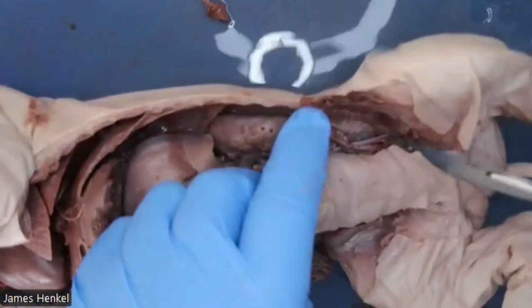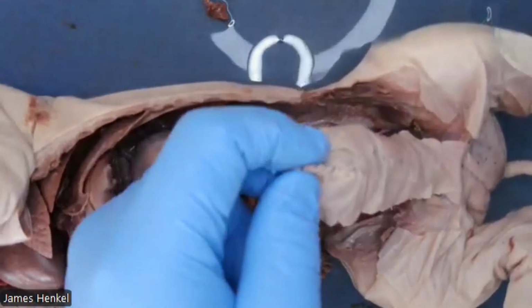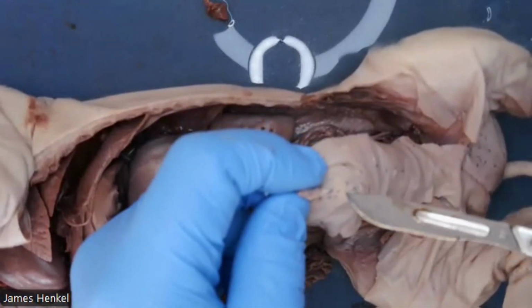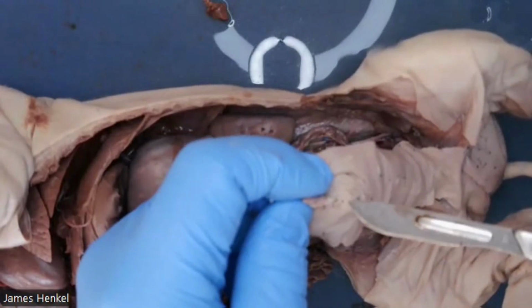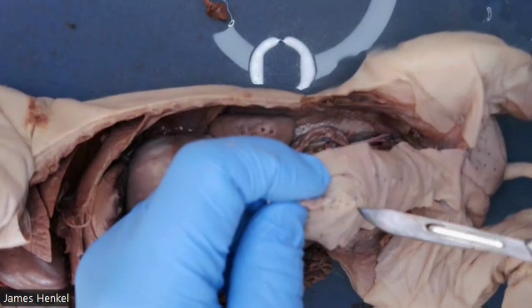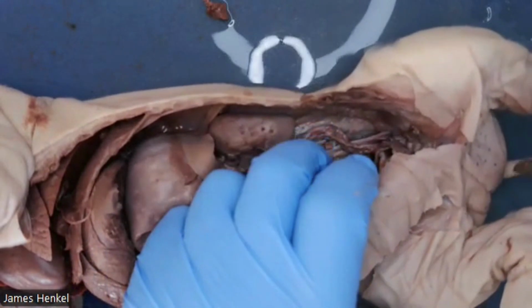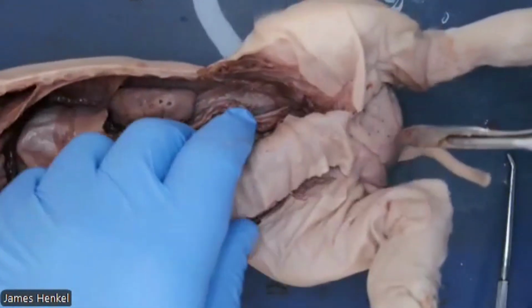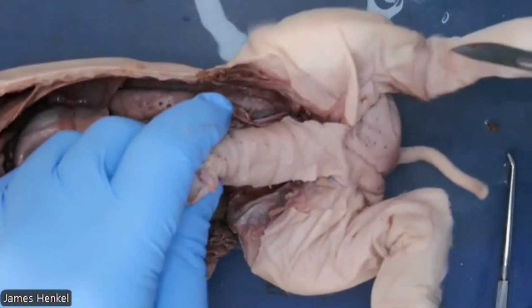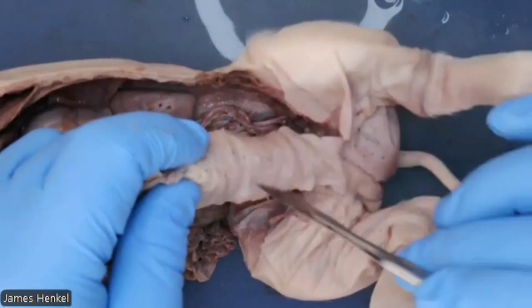Good morning. We are going to look at the male reproductive organs in this case. And what you can see first is that this is the urogenital opening. This is the hole underneath the umbilical cord on the ventral side. This would be labeled as the urogenital opening, comma, male, because it is a male thing. The female opening, as mentioned before, is in a completely different area.